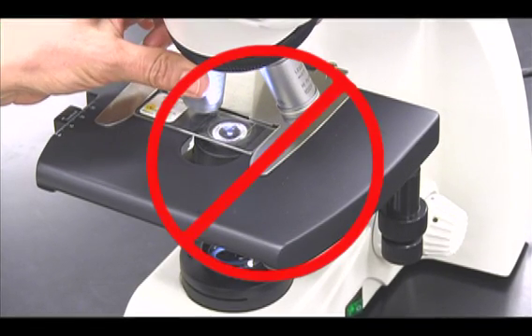Do not use immersion oil with any lens other than the 100x. If this happens by mistake, notify your instructor immediately so that the lens can be cleaned.